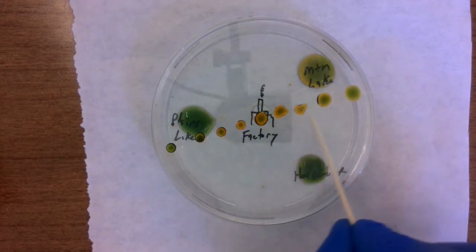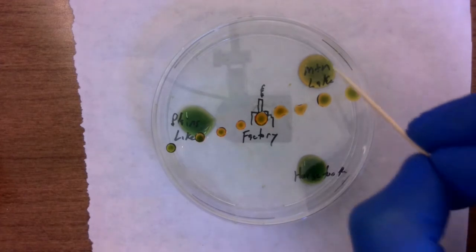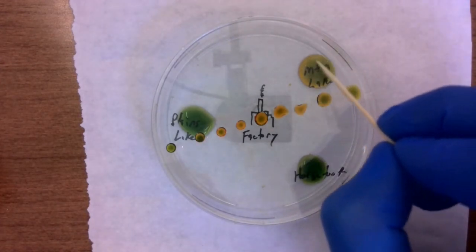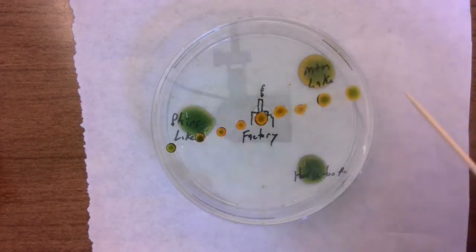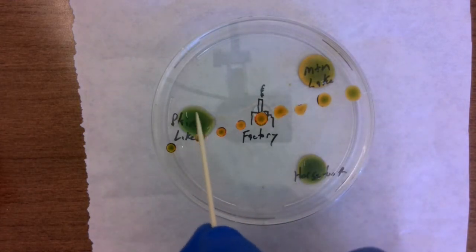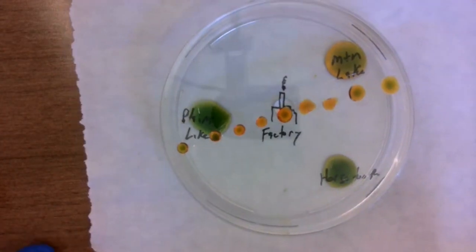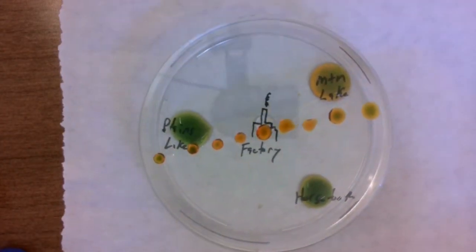Okay, very orange on these clouds with a little bit of green in the middle. The mountain lake is continuing to turn an orangish color. Starting to see a little yellow there too. If you look at Horsetooth Reservoir, we've got a tiny bit of orangish, yellowish on the outside edges, maybe a little bit on the Plains Lake too. Okay, just keep running this.